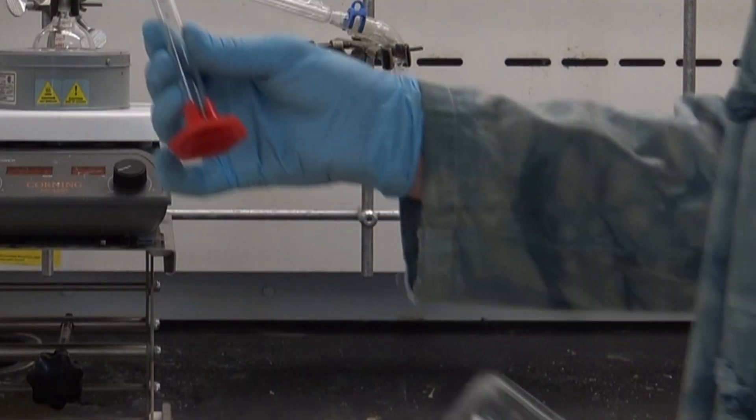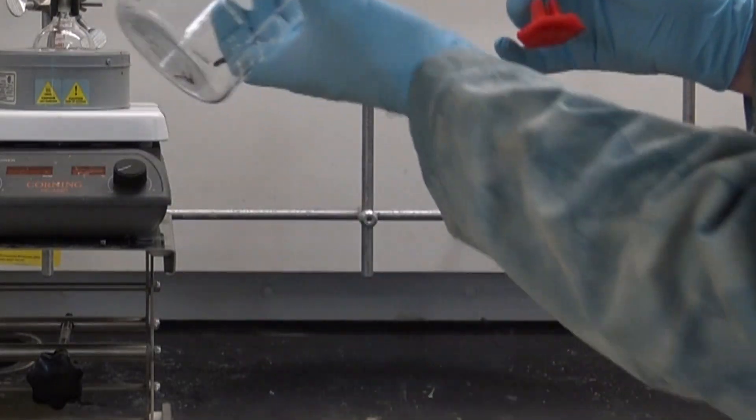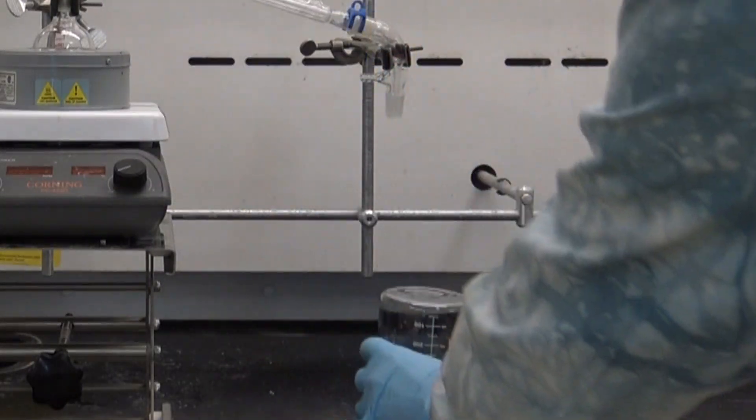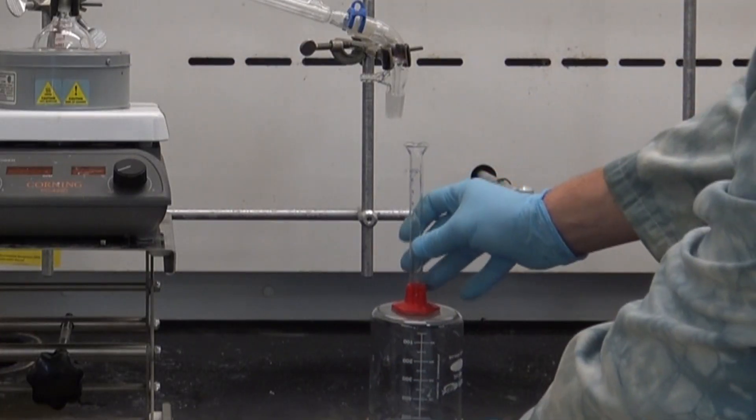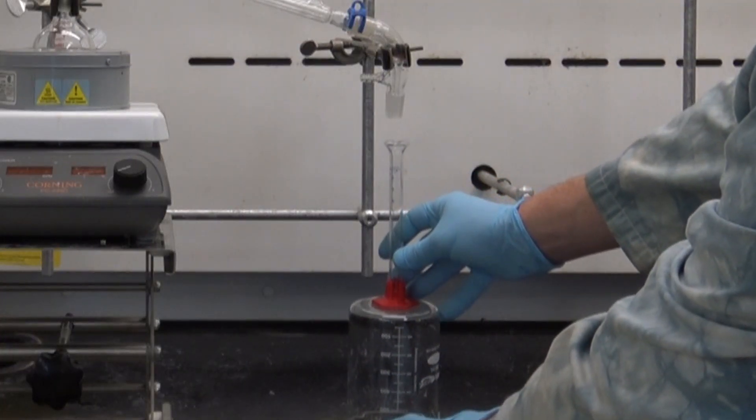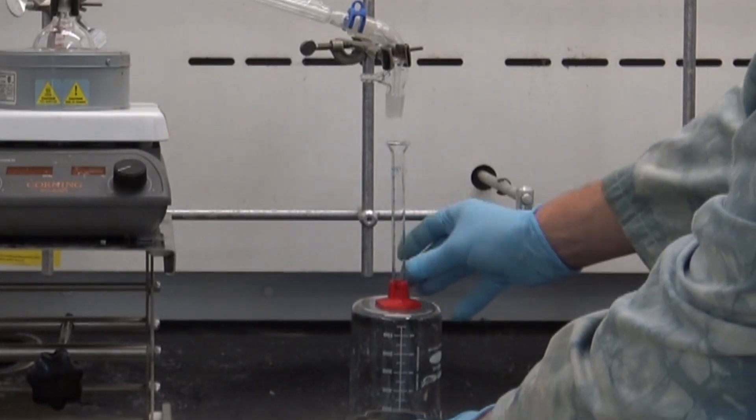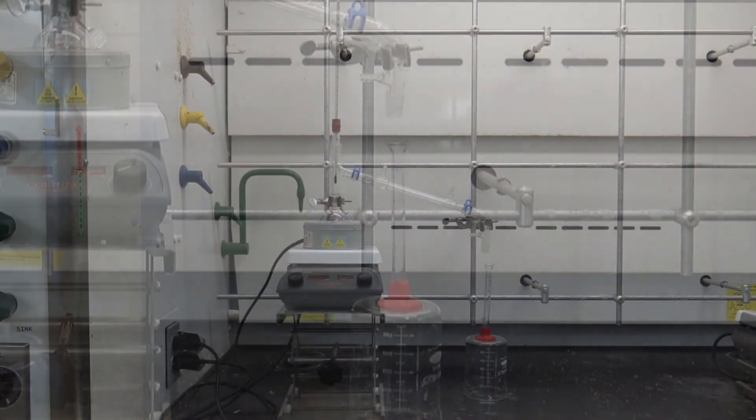Finally I'm going to need a receiver and for this I'm going to use a beaker to get some elevation and I'm going to use a graduated cylinder to collect my distillate because it's so very important that I know exactly what the volume of distillate is that I've collected.